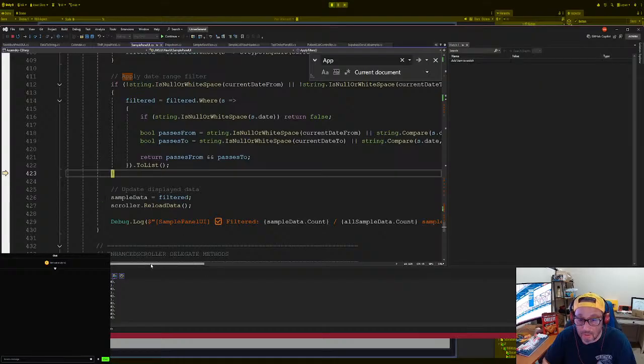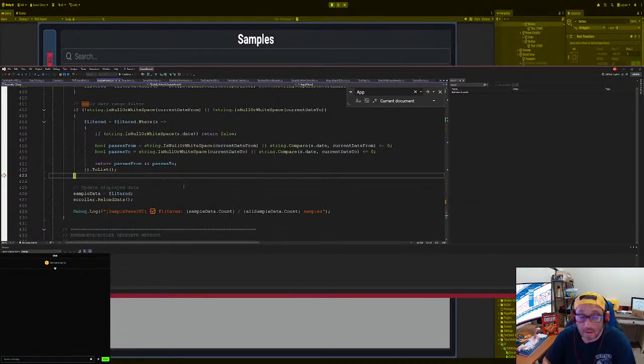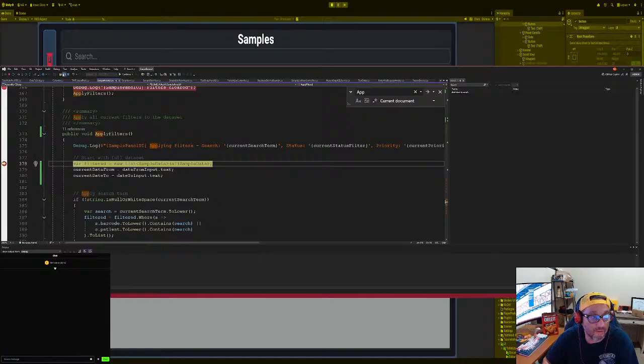All right, so what did we do wrong here? If this is from, compare the date from to the, there, passes to, compare that, the return passes from, passes to, which then ends up being a filter. Actually, you know what? Let's just click on here. Continue, right? Let's do it again. Filter, apply filter.